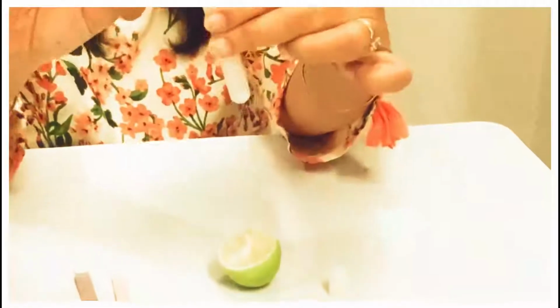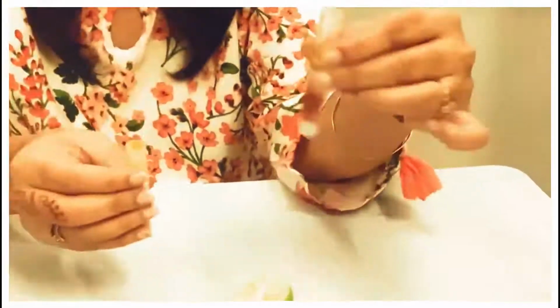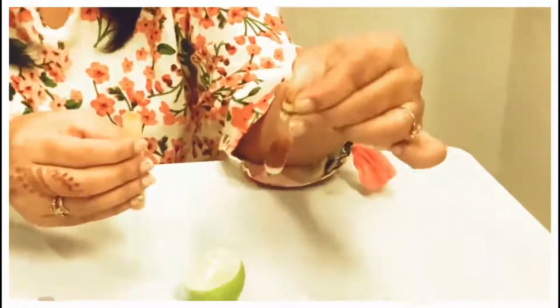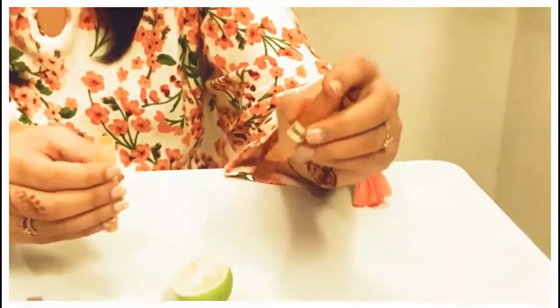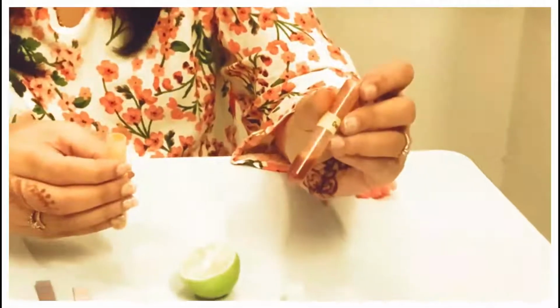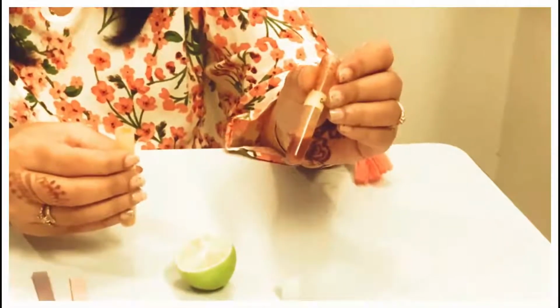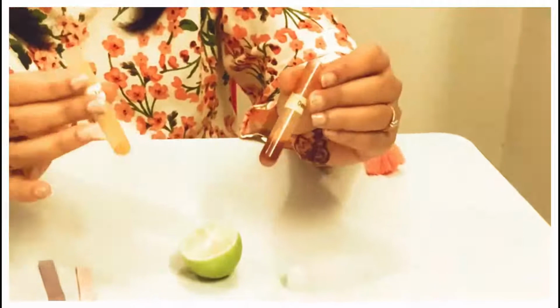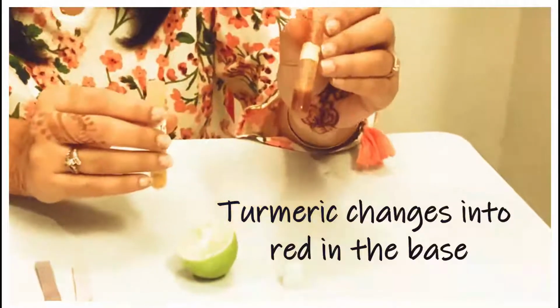Just watch the change of color. Can you see the change of color? I just try to shake it all so that it gives the perfect color in the base. Can you see the change of color? It is blood red. So the yellow turmeric changed into blood red in the base.